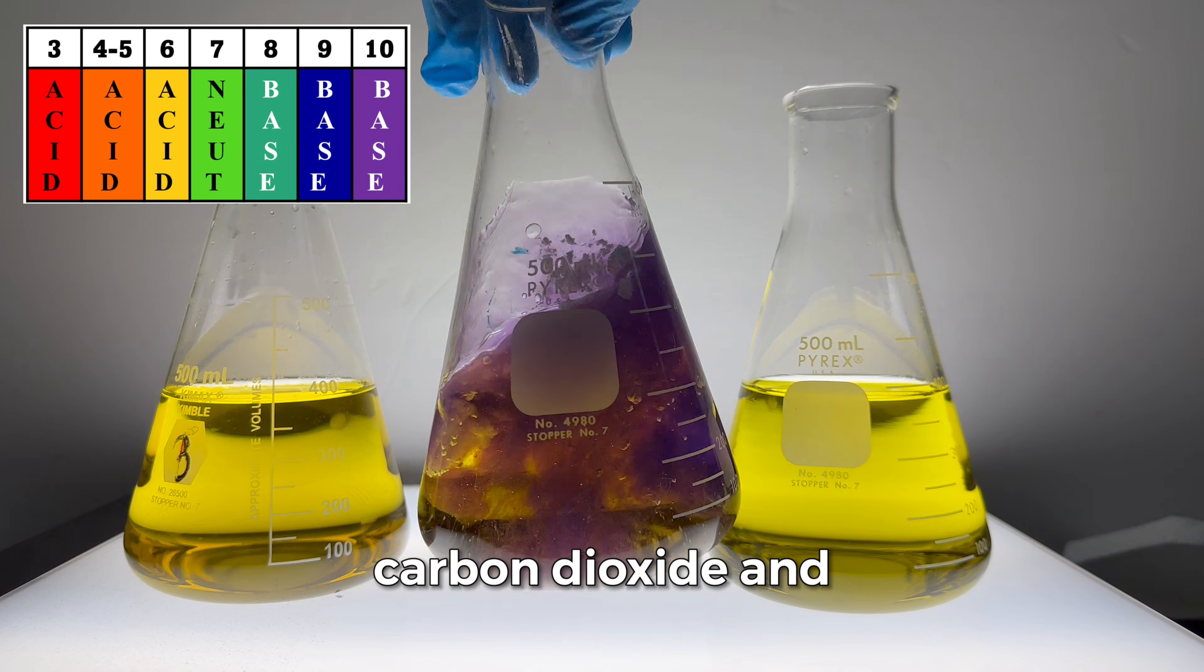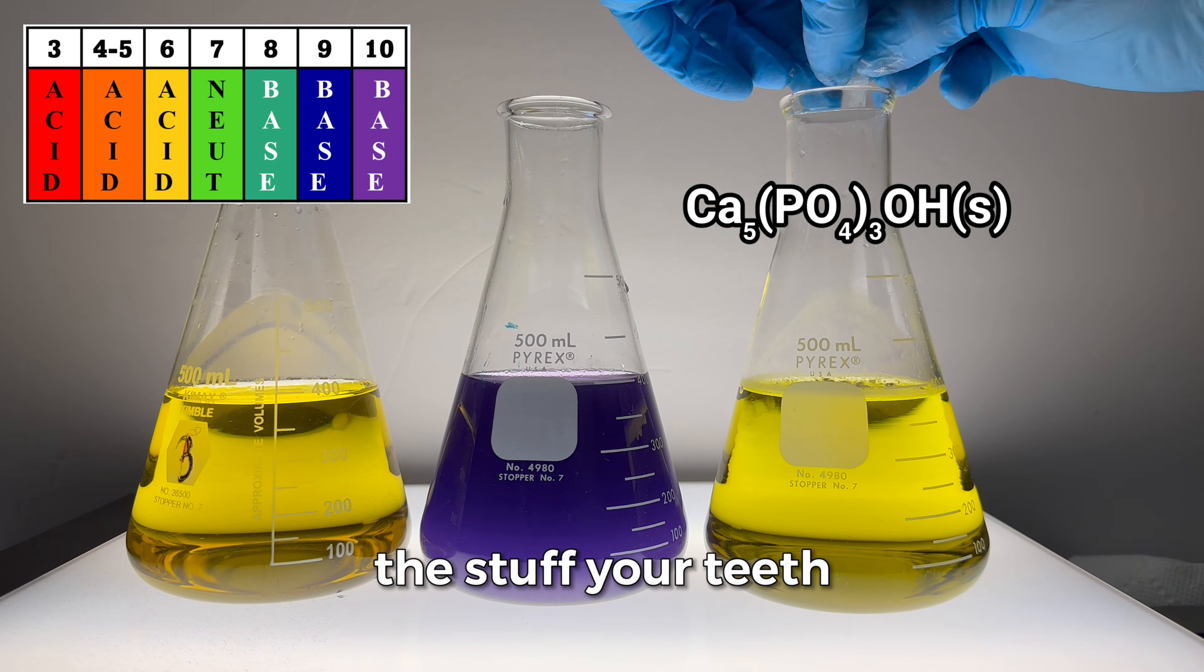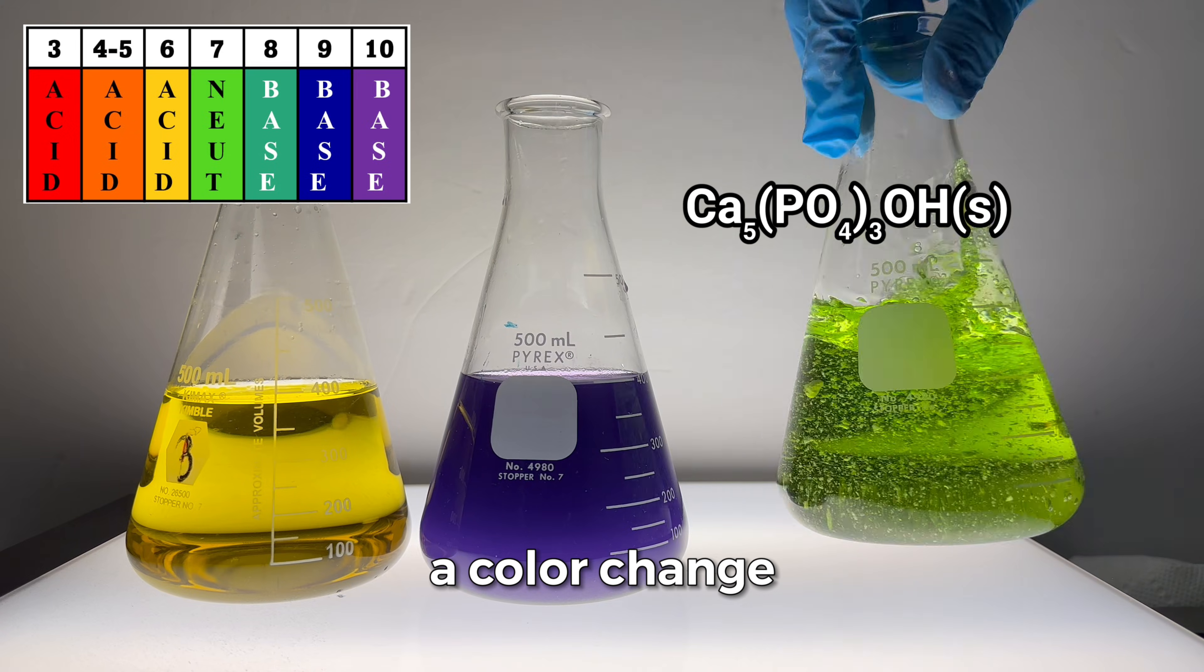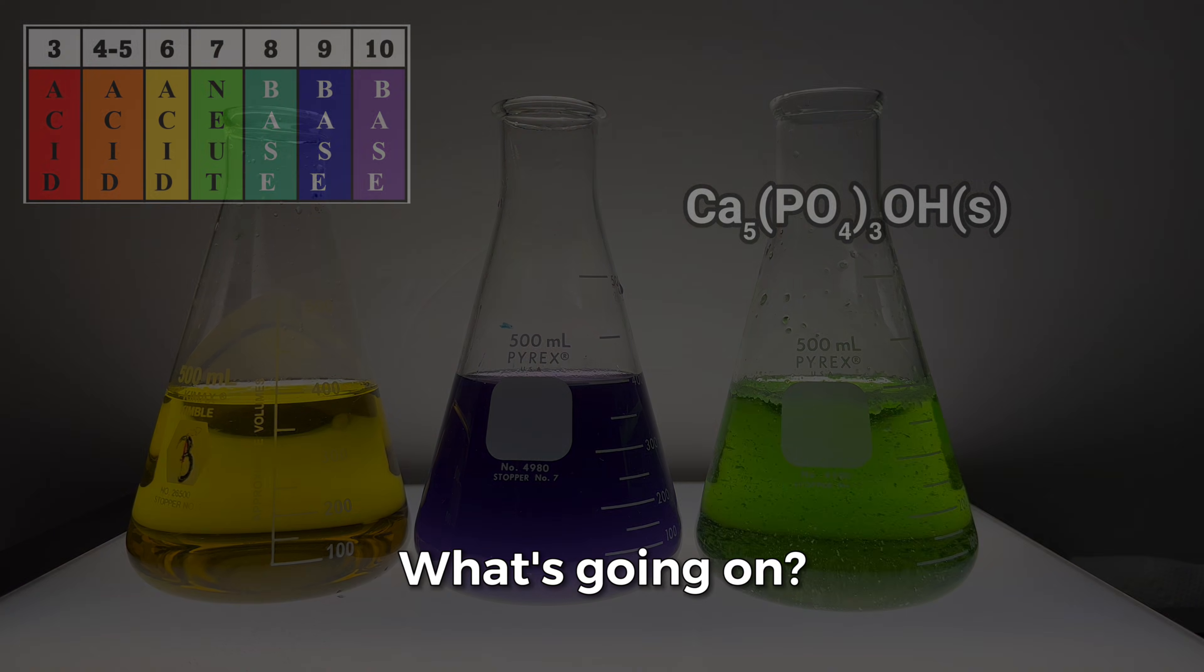This neutralizes the carbon dioxide and then some. Now let's try the same thing with hydroxyapatite, the stuff your teeth are made of. We get a color change again, but this time the solution is neutral, not strongly basic. What's going on?